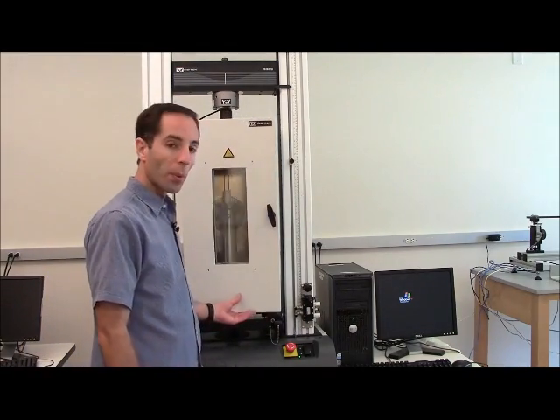If we had everything all set up of course we can shut the door now and the operation of the oven is fairly straightforward. The controls are on the back or on this right side on the back and setting the temperature is fairly easy. There's a fan inside to distribute the heated air evenly and operation of the Bluehill software of course is exactly the same and you can run the profile for doing compression tests.